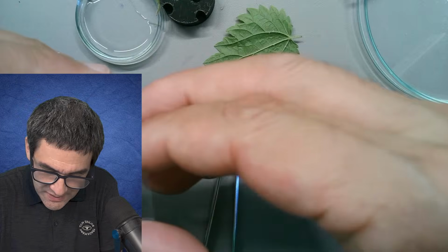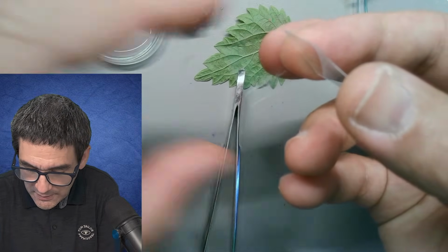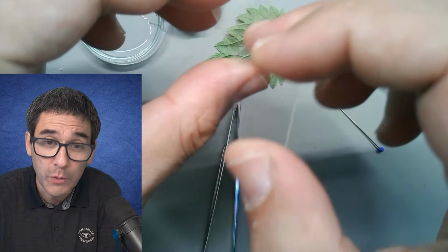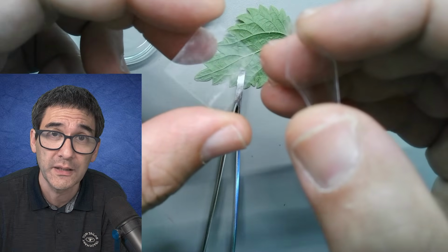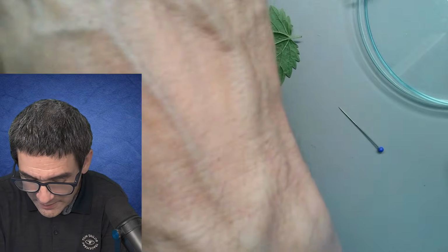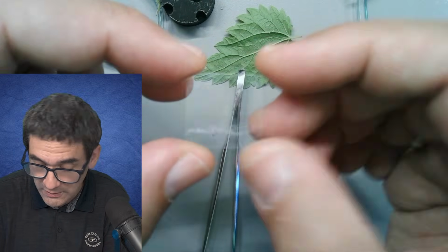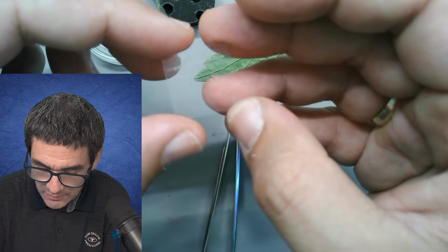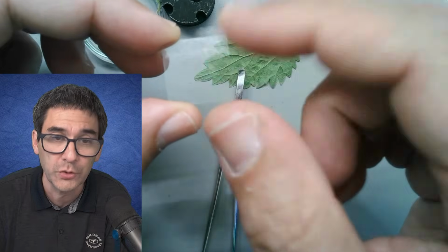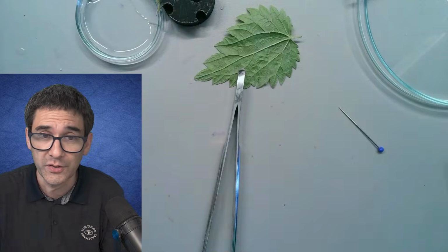if you've got those water stains on some of those, like this one, these are some pretty bad ones, right? Then this is actually calcium carbonate, and you have to use acid, for example vinegar or something like that. But isopropanol, or any other alcohol, is only going to be useful if you've got fats and oils. Generally, there are not so many unless you've got really fatty or greasy fingers. Isopropanol is probably not going to remove water stains very well. It's more suitable to use, let's say, vinegar or other weak acids.